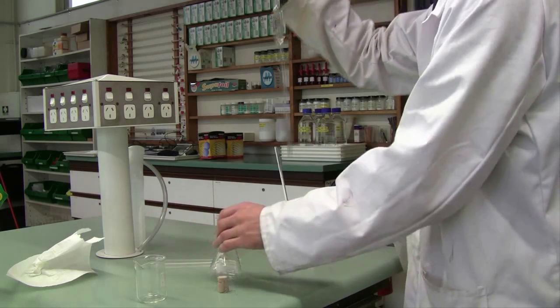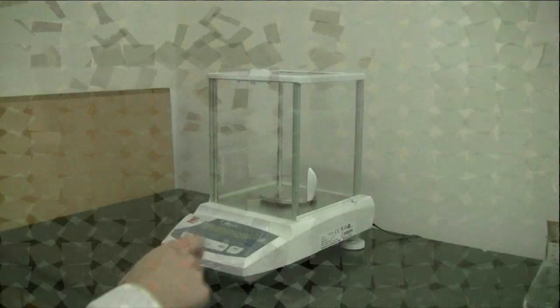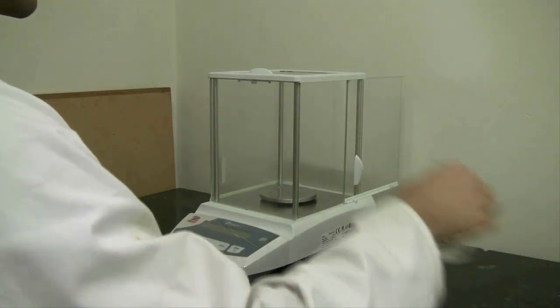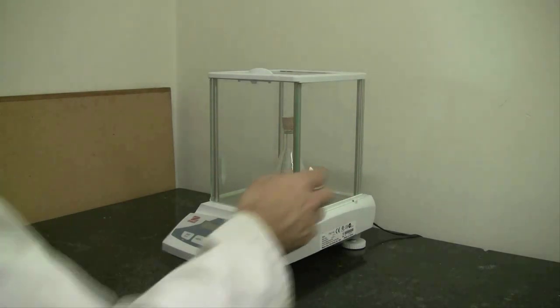Once you've delivered your 20 mls as accurately as possible, re-cork your conical flask, go back into the balance room, use the same balance, re-zero it, pop your flask in the balance, shut all of the doors and take a reading again, a mass after you've added your water.